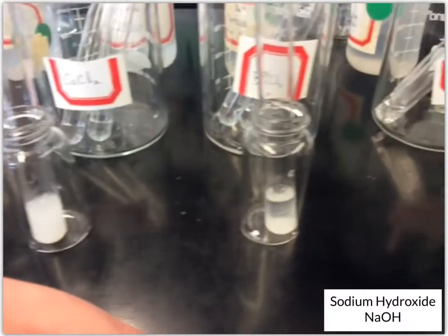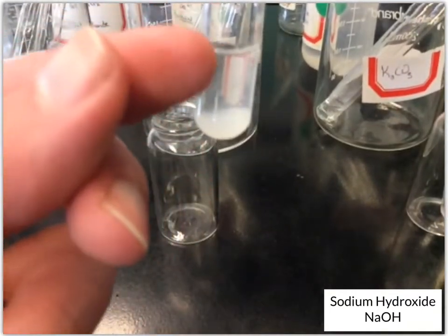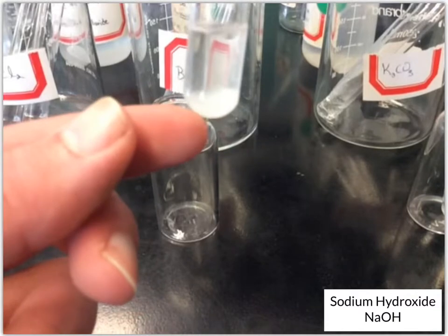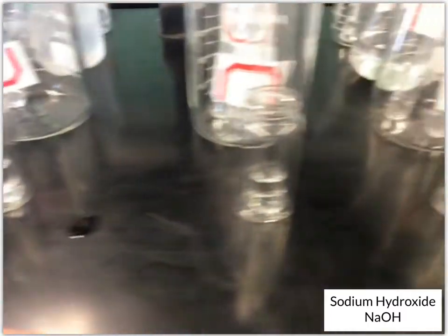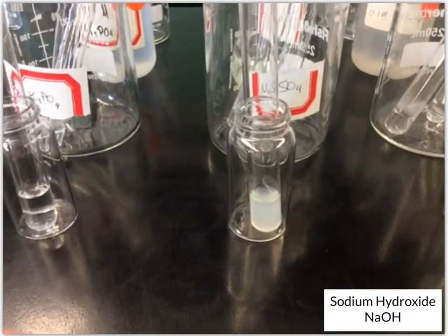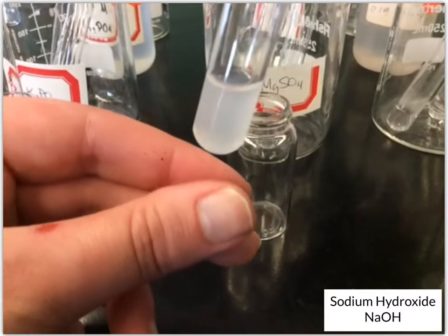And then the barium chloride. This one has also started to settle, and so the solution's a lot more clear. You definitely have some precipitate, some white precipitate down at the bottom. And then let's see the other changes we had. We had the magnesium sulfate, and so you've still got kind of this cloudy solution.